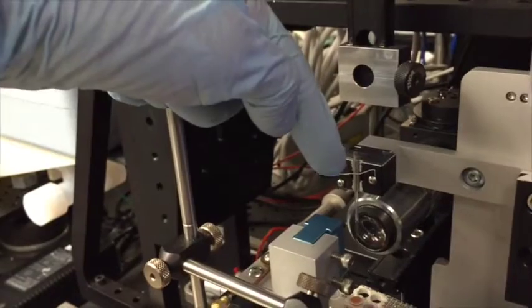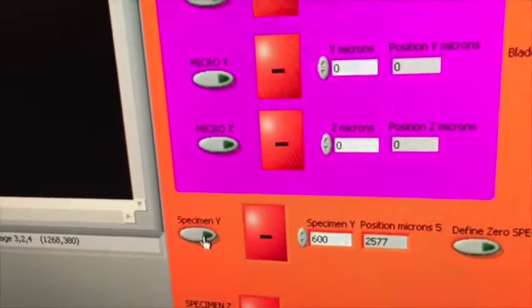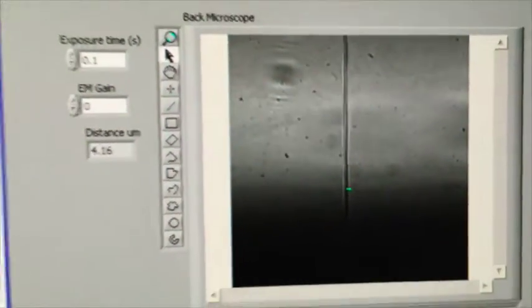And again, what just happened is, this is the cutter. It moved from near up here, back here. We can see that evidence right here. And as we remember, we moved the tip up 600, so we'll change the direction to down. And as I click right here, you'll see it come back into play. There we go. We now have a clipped and dipped tip.